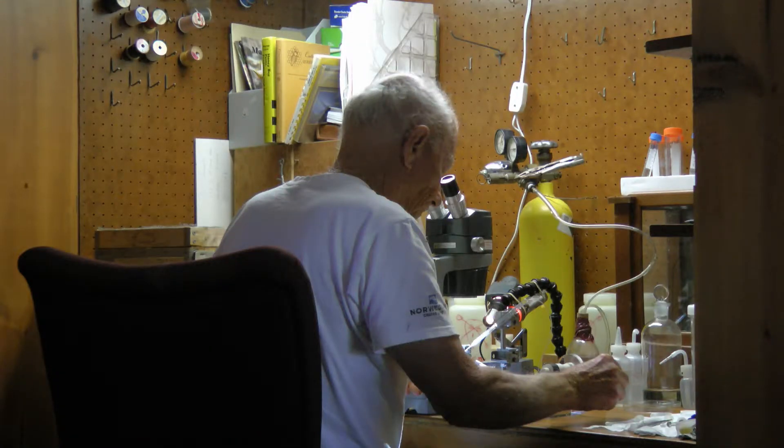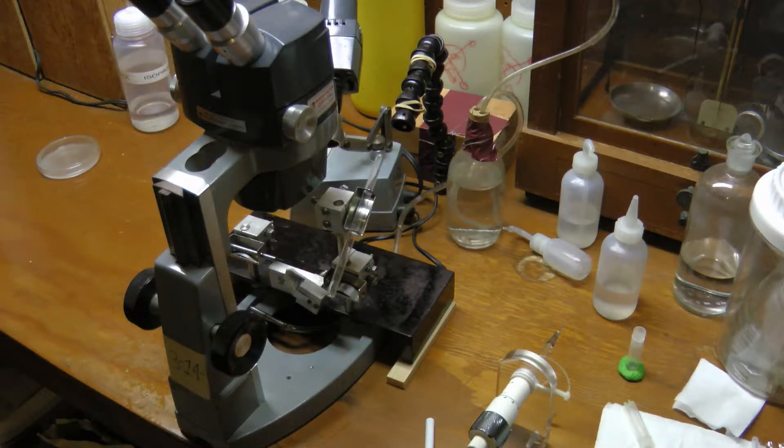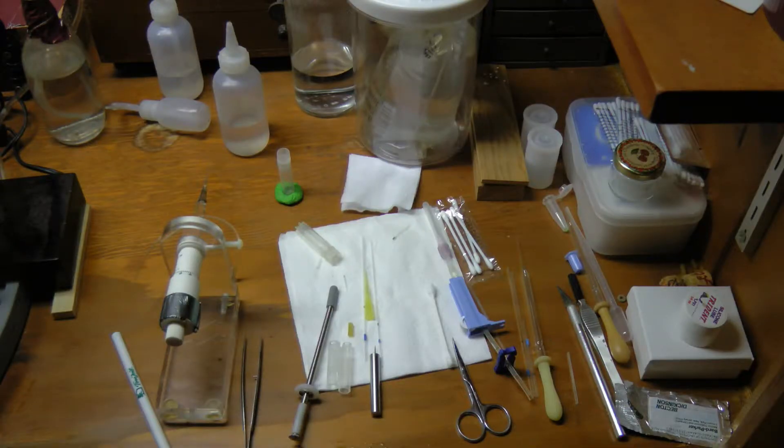Here's Bill at his workbench. He uses a 30x magnification stereo zoom binocular microscope.